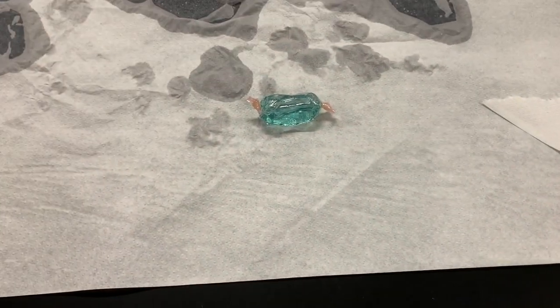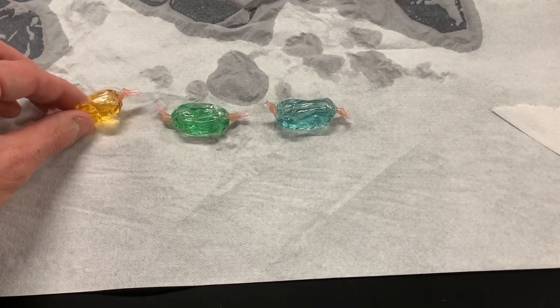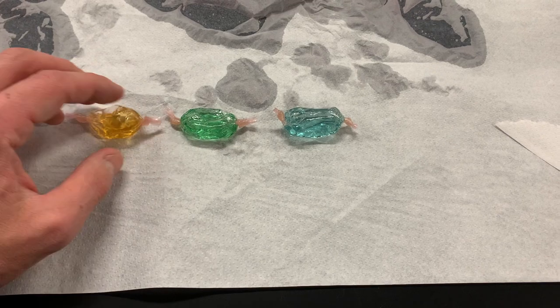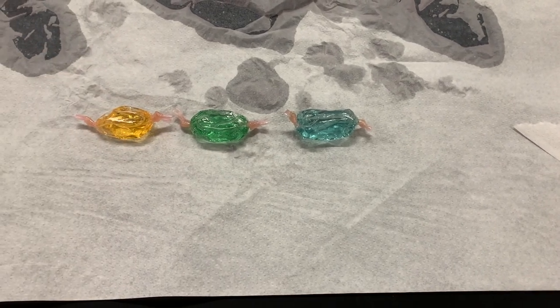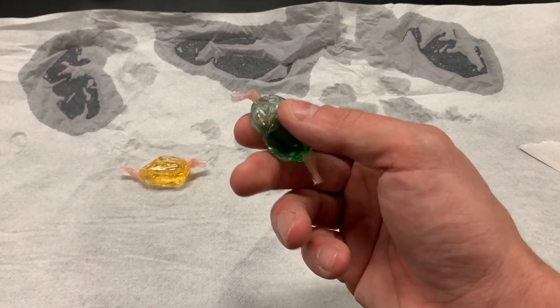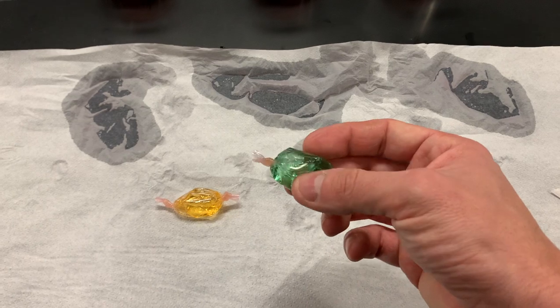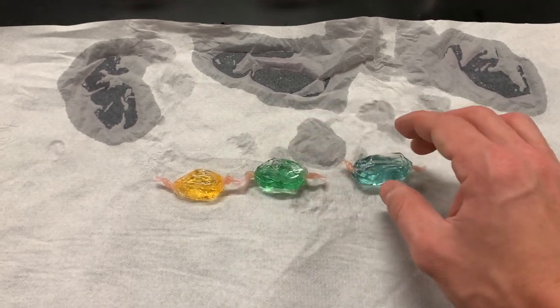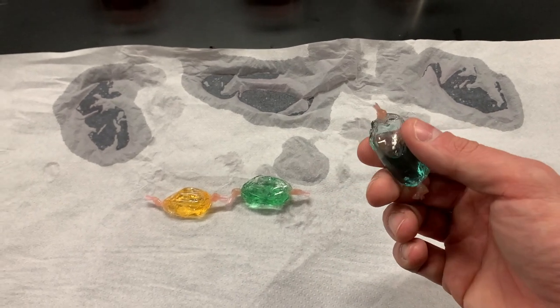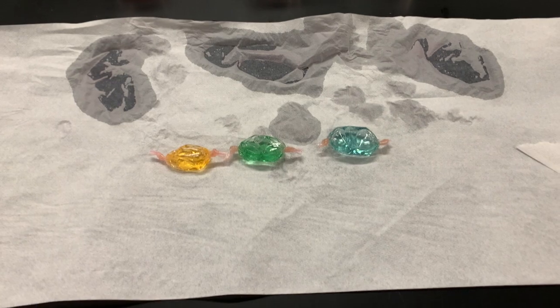Final observations: the yellow one is definitely smaller than before, and it's not as yellow as it once was — it's almost like a hay or light orange color compared to what it was initially. The green one — I don't see much color change. The dialysis tubing is still slightly loose; the water is not very taut around the outside. The blue one has definitely gotten bigger — the liquid is pressing more against the walls, and it feels almost like a filled balloon, though no major color change there.